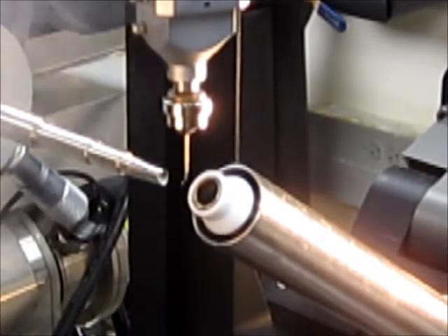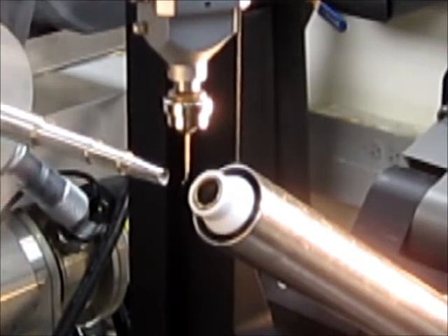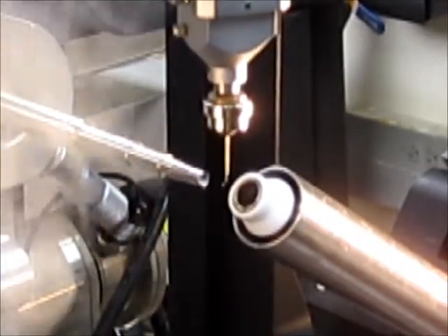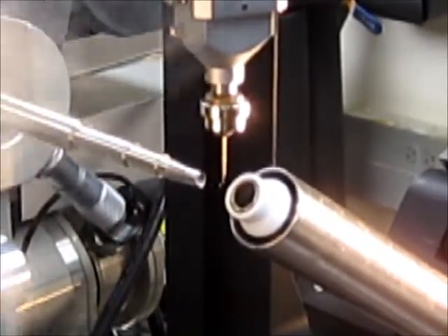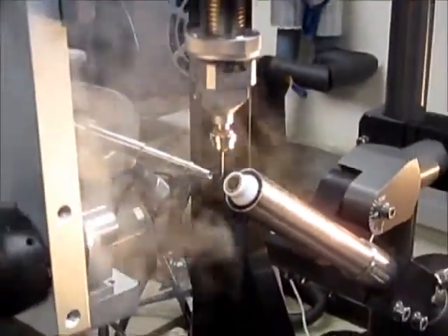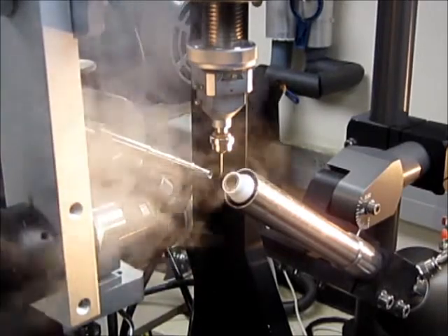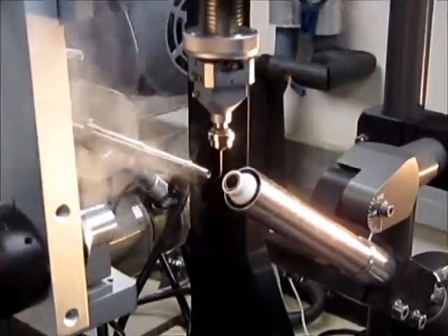As you see the crystal is at the end of the crystal cap and is frozen in place on the cryostream. I can try to focus a little bit more to see whether I can see the crystal. But that is the way to flash cool the crystal in cryostream.